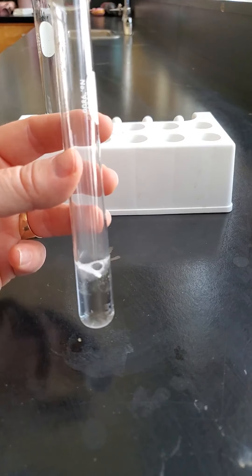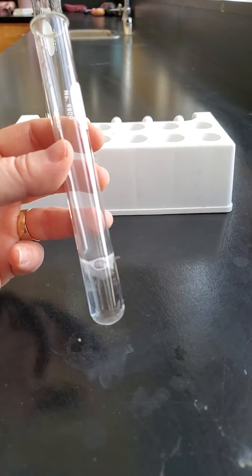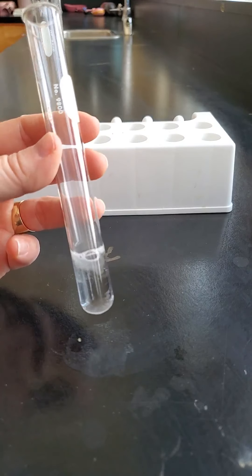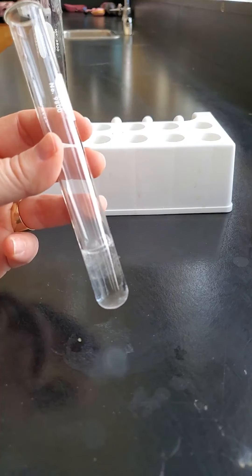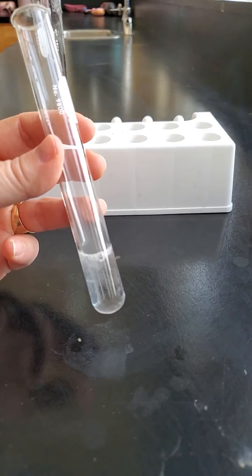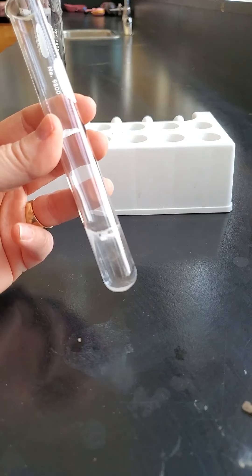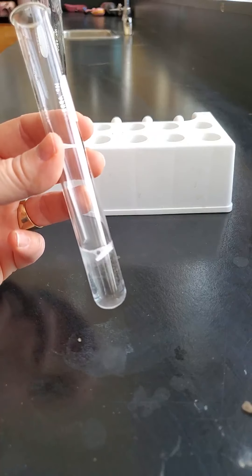That's different than when we looked at carbon dioxide. Carbon dioxide made the flame go out, but this makes a little popping noise. So there you have it - magnesium in hydrochloric acid.